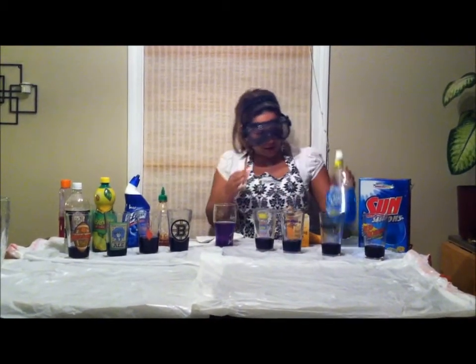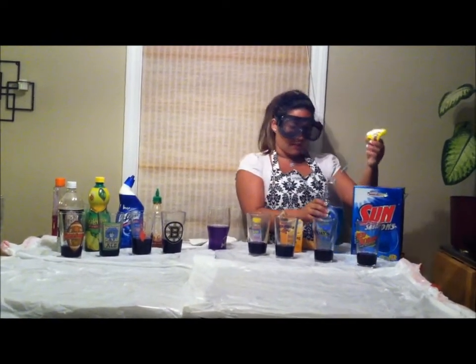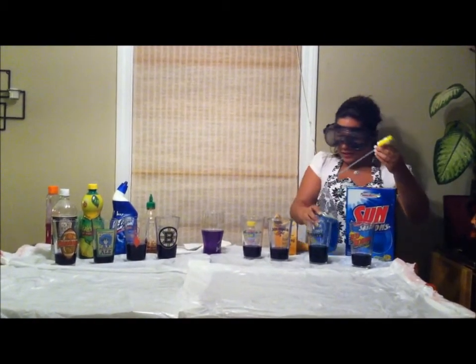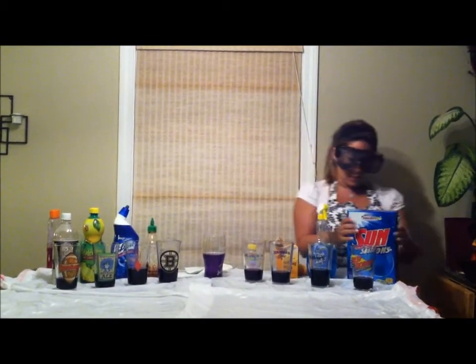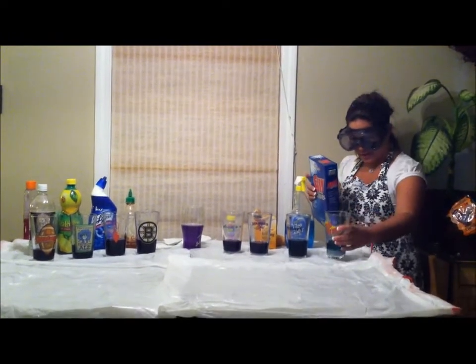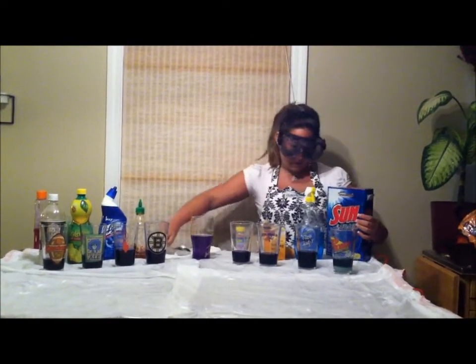And then here we have your household Windex or glass cleaner with ammonia. And this is already blue, so we'll have to see what kind of indication it'll give. But these are all bases that we know, so they should give some darker blues or green colors. And then we have some sodium carbonate, which is your standard dish detergent. Got a nice green color there. Let's mix that up a little bit.